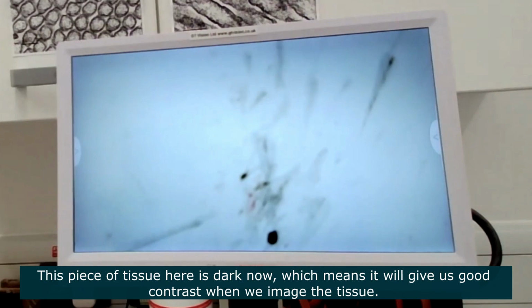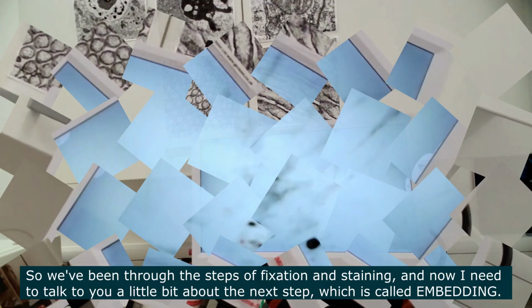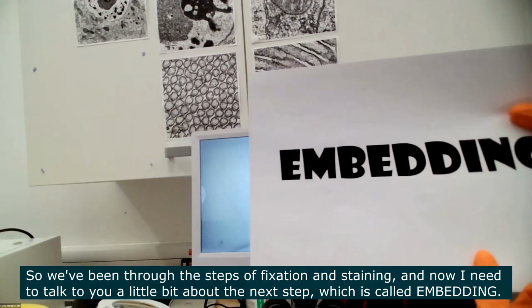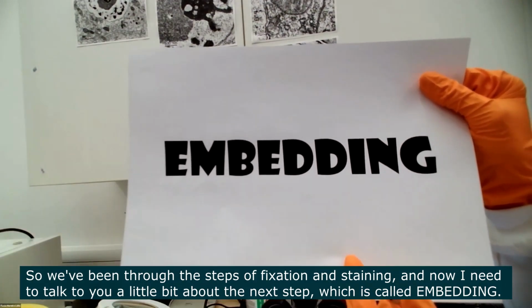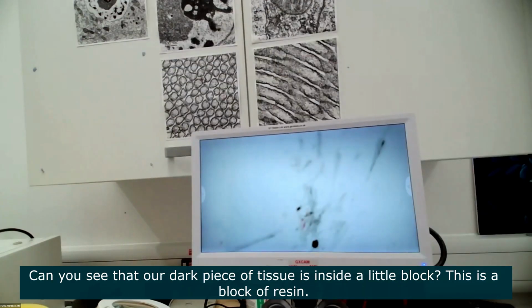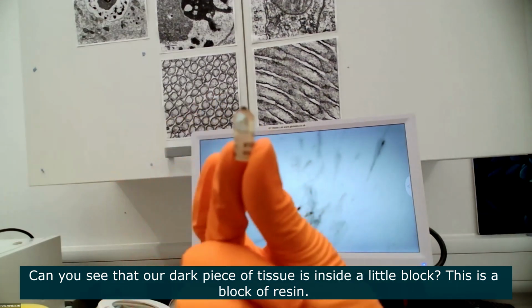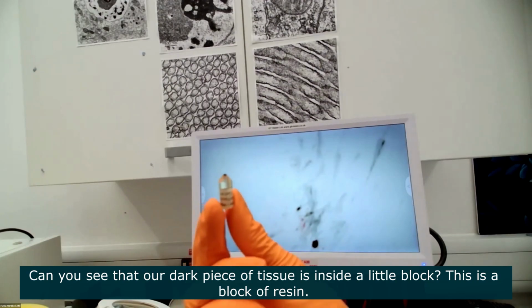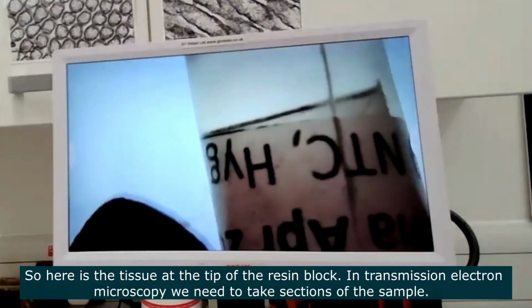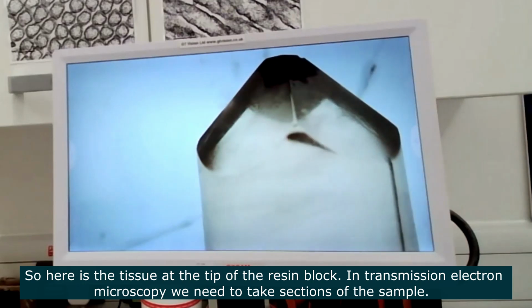So we've been through the steps of fixation and staining, and now I need to tell you a little bit about another step called embedding. Okay. So once we have the dark piece of tissue, can you see that this piece of tissue is actually inside a little block? So this block is called a block of resin. I'll put it under here so you can see. So this is a block of resin.